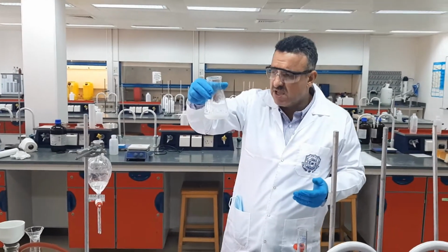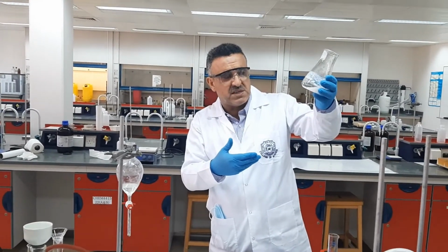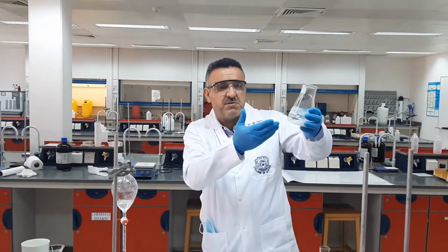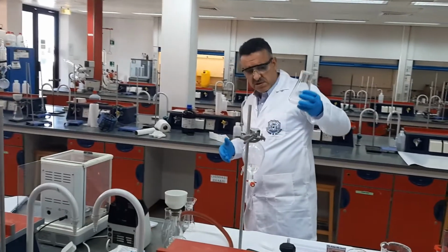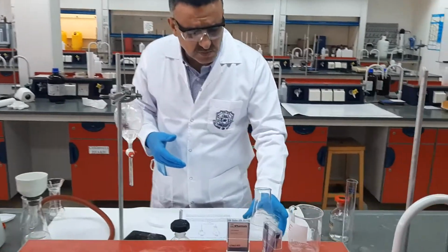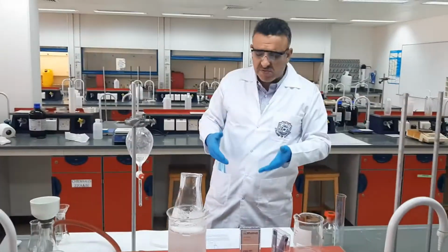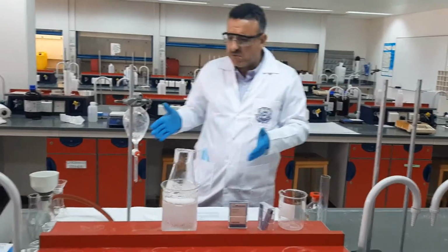Now, in order to get more and more of the benzoic acid, we need to minimize the solubility of the benzoic acid in water, and to do so, we need to put it in ice cold water in order to decrease the solubility, as I said. But of course, we are not going to wait for long, so I'm just showing you what we have to do.